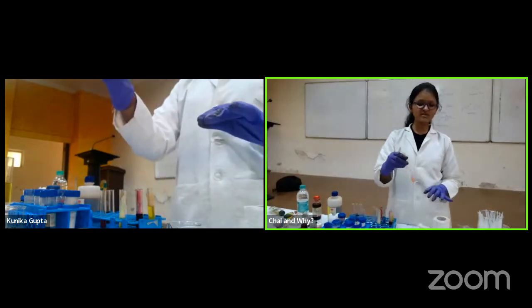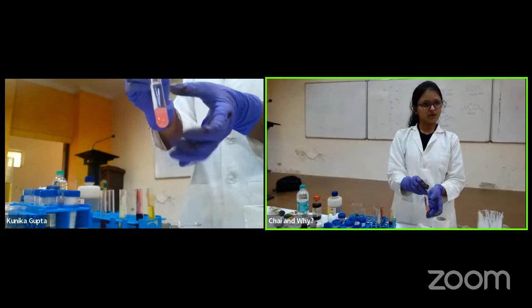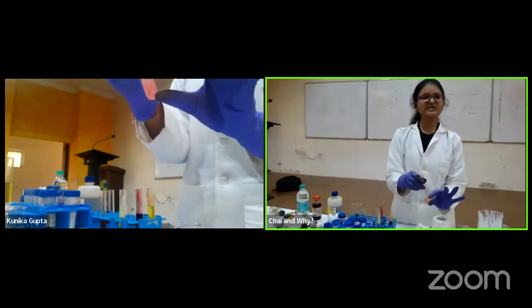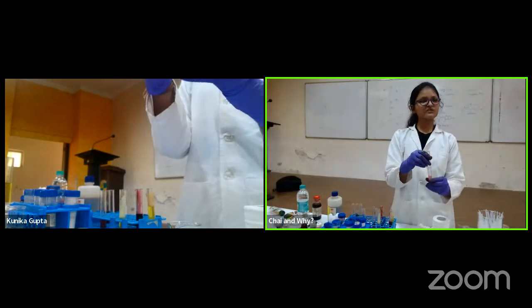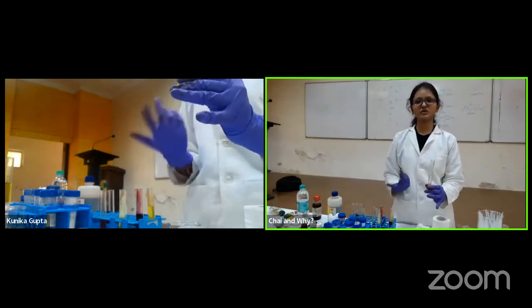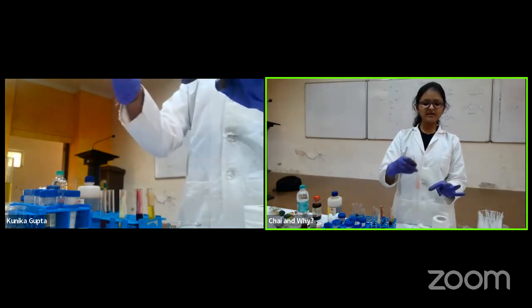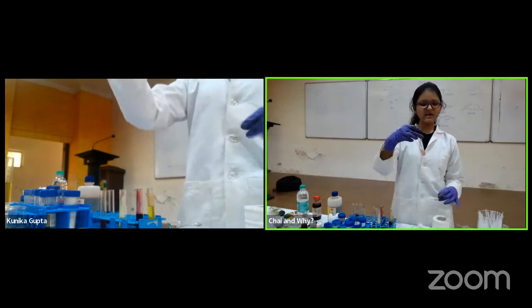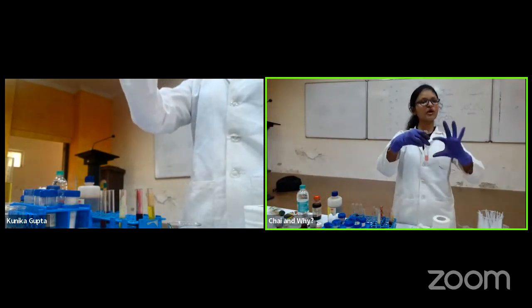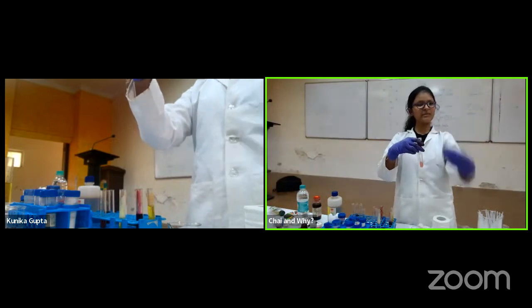So what I'm doing is purification. This is the first level of purification that I can do. Because the things which are soluble in organic solvent I cannot take care of, but which is water soluble, at least that first level of purification I can do this way. So I will dissolve it in water so that the acids and bases which were soluble can come out. Now I am showing you how the layer forms. So what we have is a separating funnel. It has a pipe down there.